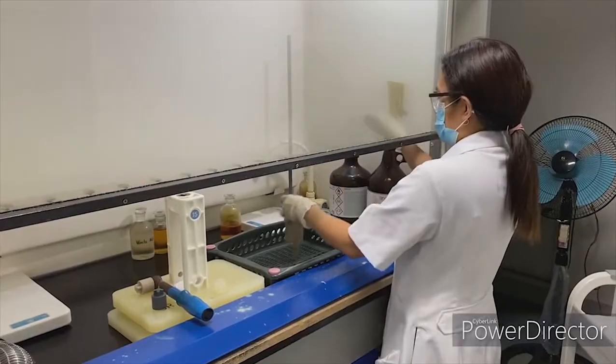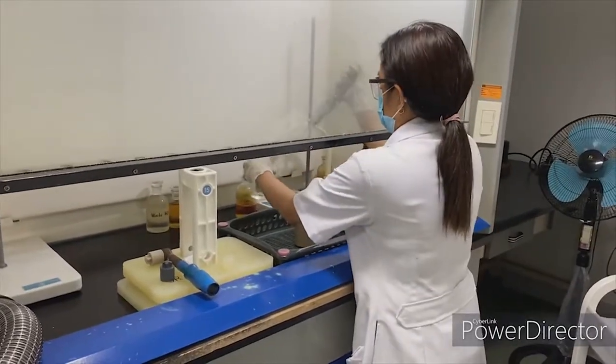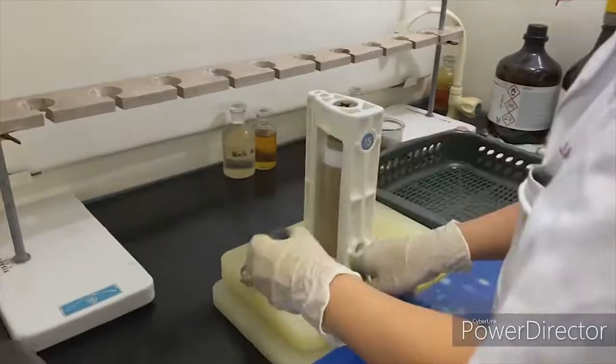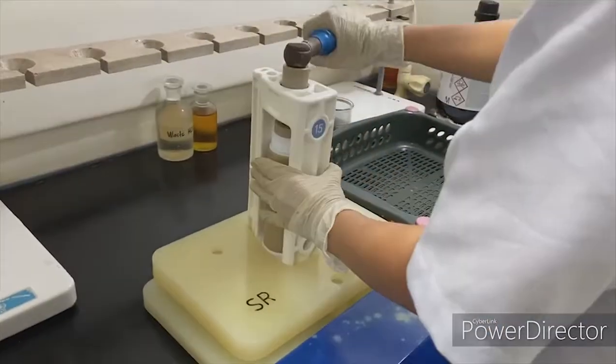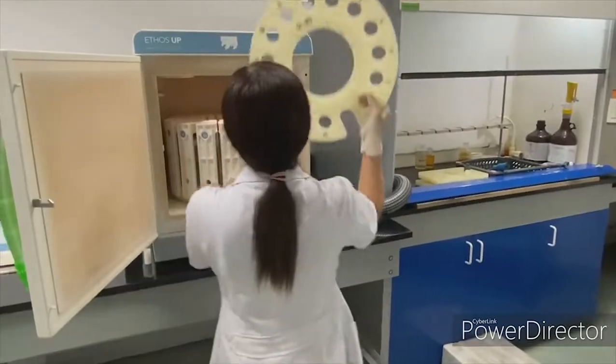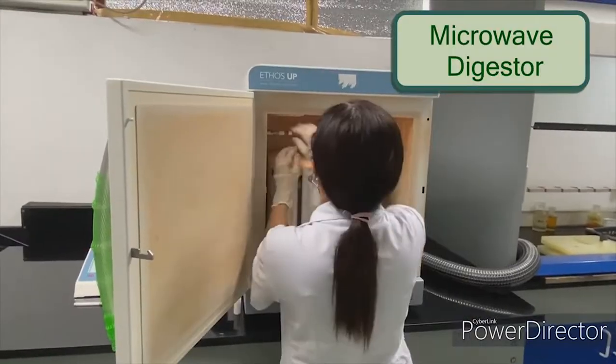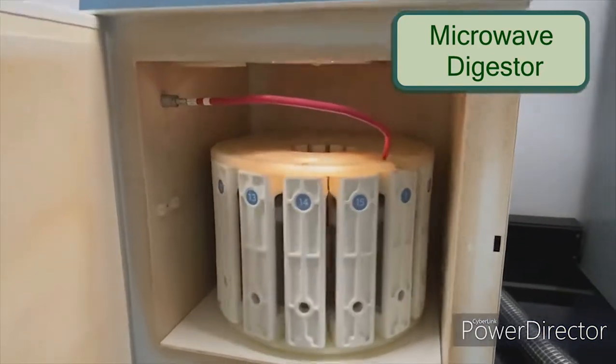For fertilizer samples, after the sample preparation, the samples are digested using the microwave digester. Microwave digestion uses less amount of acids and is conducted in a closed system, eliminating dangerous fumes by directing it in a fume hood.